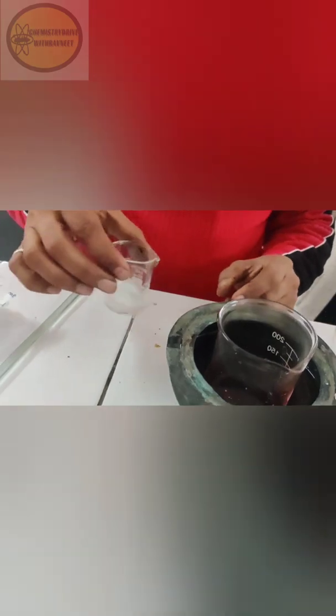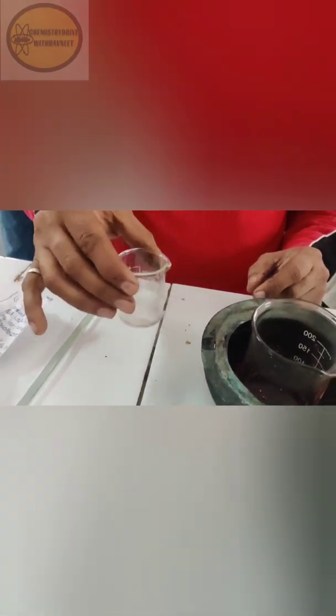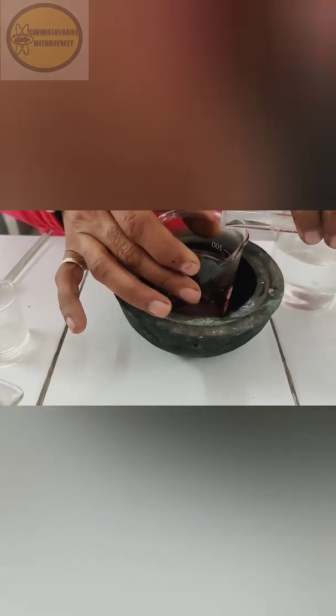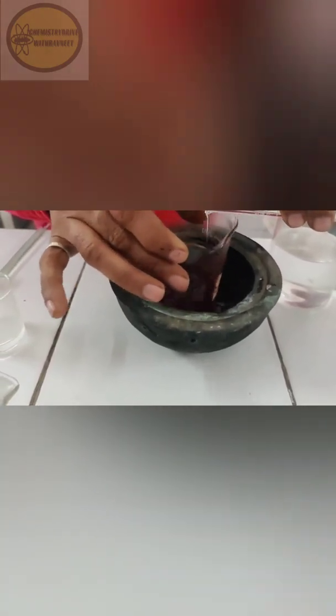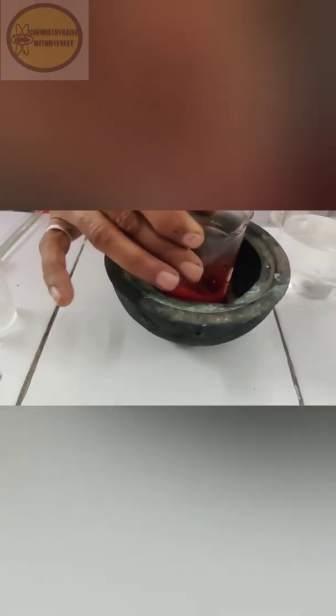While the solution is cooling, prepare a solution of sodium acetate in water: take about 4.2 g of sodium acetate in 10 ml of water. Add 5 ml of this sodium acetate solution to the reaction mixture and stir for about 30 minutes while maintaining the same temperature. You will see that the color has changed.